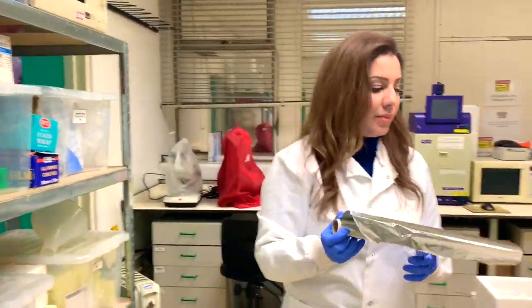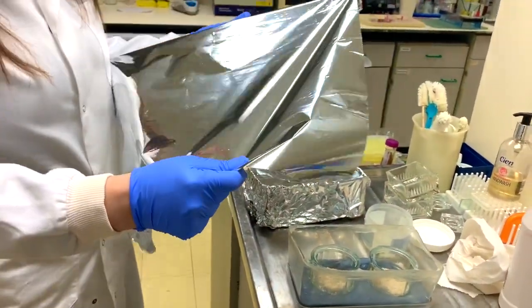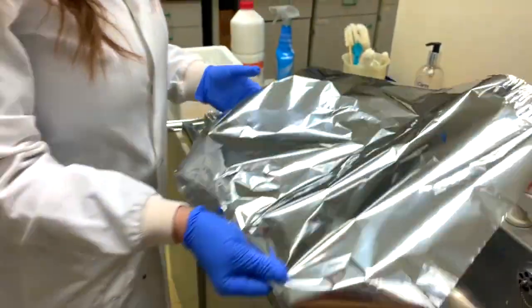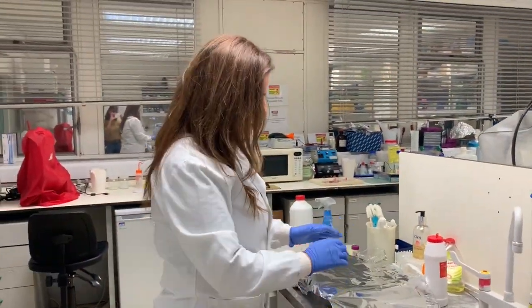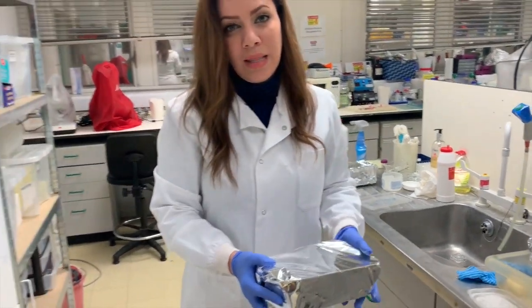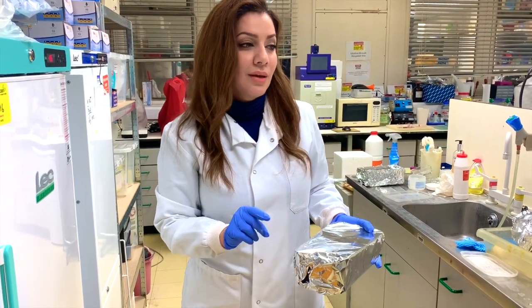And then we use a little bit of aluminium foil — just to cover them. This is to cover them and provide them with darkness because they prefer a very dark environment. I'll just label them with the name of the colony, the date, and keep them.